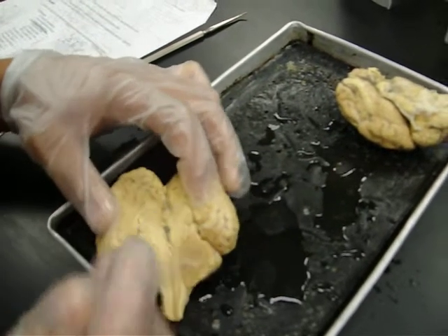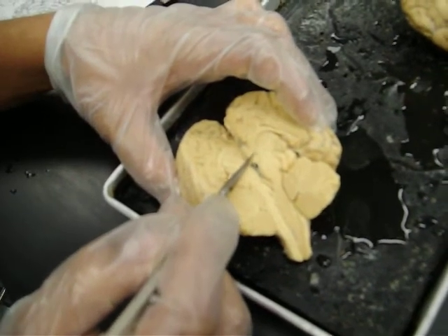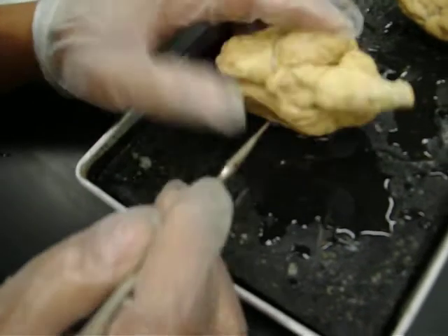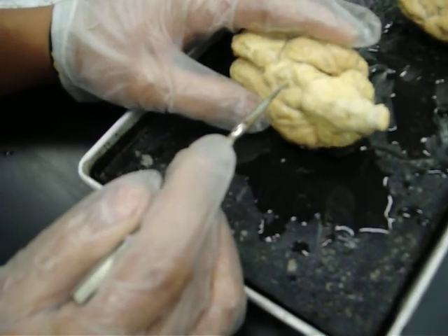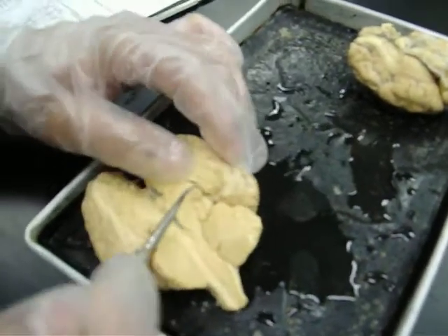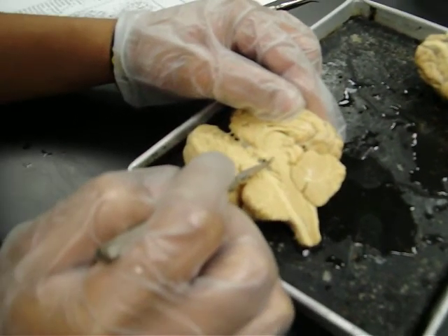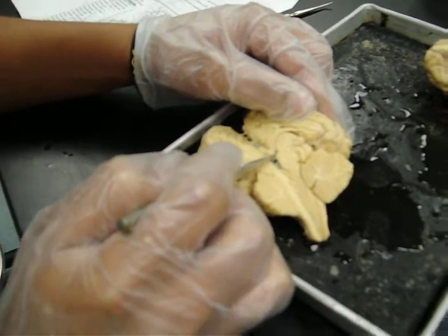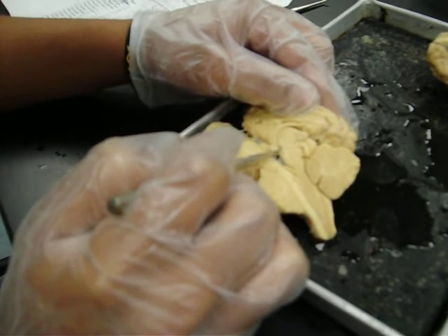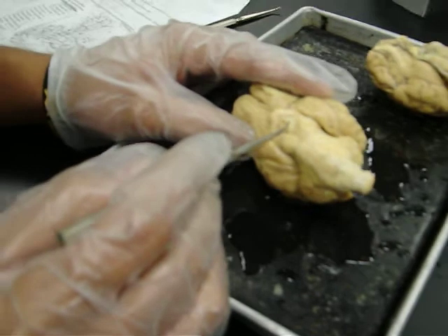And on top of the hypothalamus there is, oh, actually, I'm sorry, that's called the mammillary bodies, right here. And on top of that is the hypothalamus, right above, right here. And above that is the thalamus: the hypothalamus, thalamus, and the mammillary bodies.